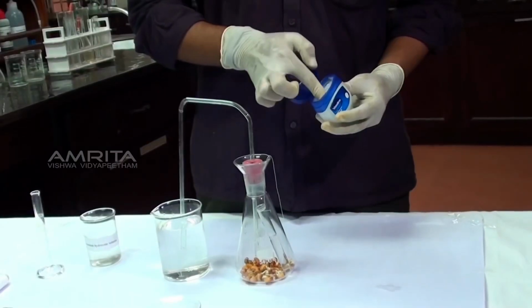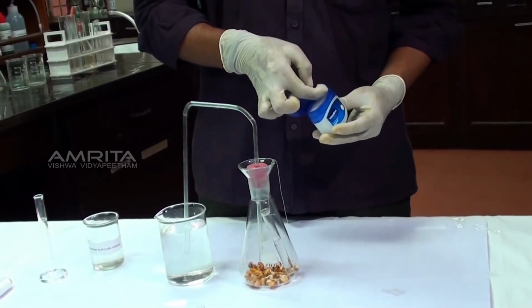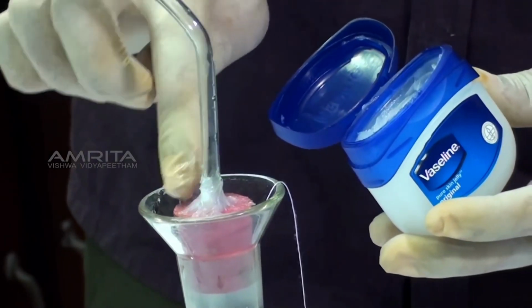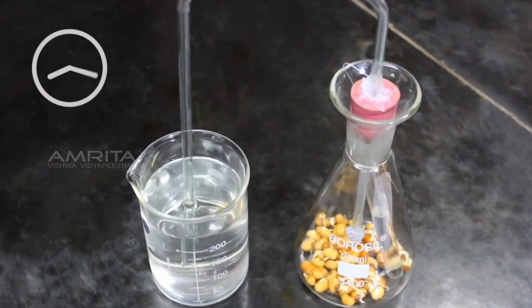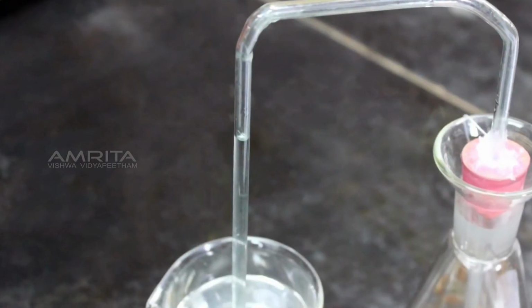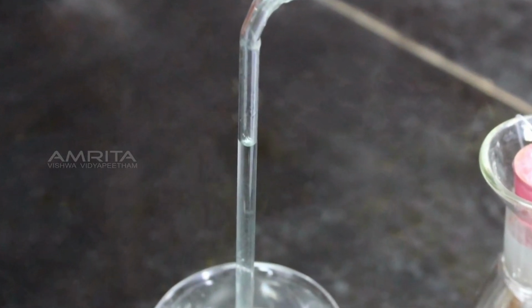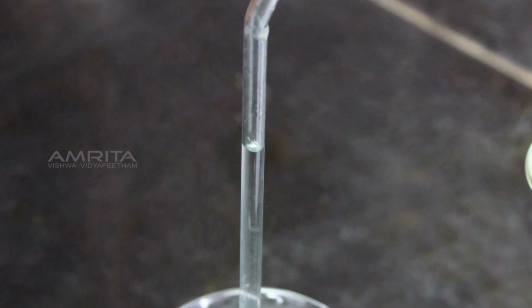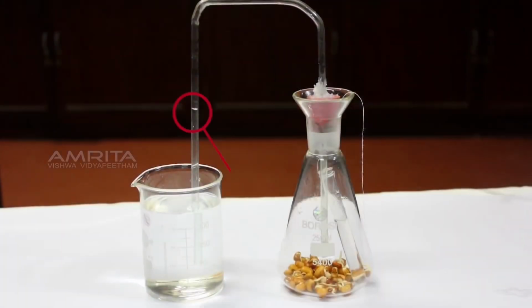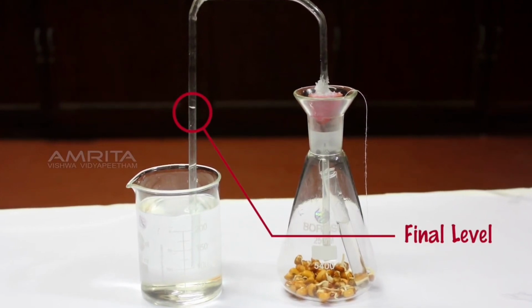Use your finger to take some petroleum jelly. Then apply the petroleum jelly on the cork to make the apparatus airtight. Keep the apparatus undisturbed for 2 hours. After 2 hours, you will see that the level of water has risen in the delivery tube at the end dipped in the beaker of water. Note this level as the final level.